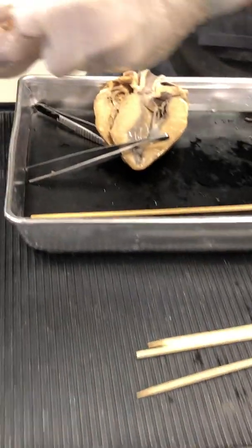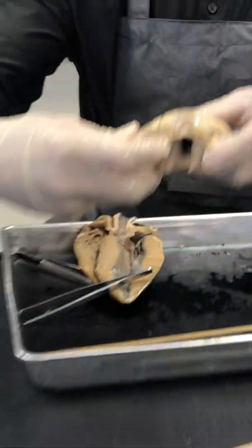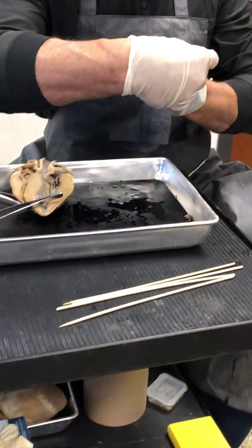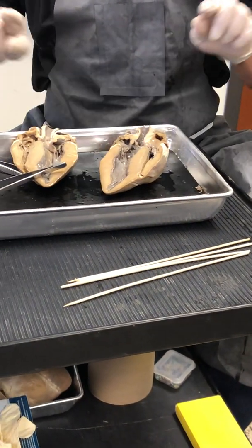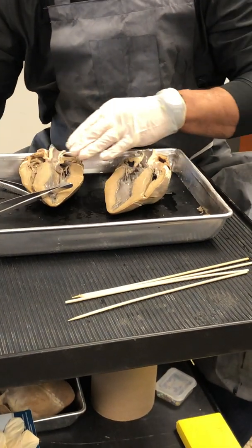So you think about the difficulty we have with these drawings trying to emulate two-dimensional versions of these three-dimensional organs. So you're looking in there to see the pulmonary semilunar valve right there. Right? So that is now the right ventricle. So blood flows to the lungs and comes back to the heart, and now we're on the left-hand side.